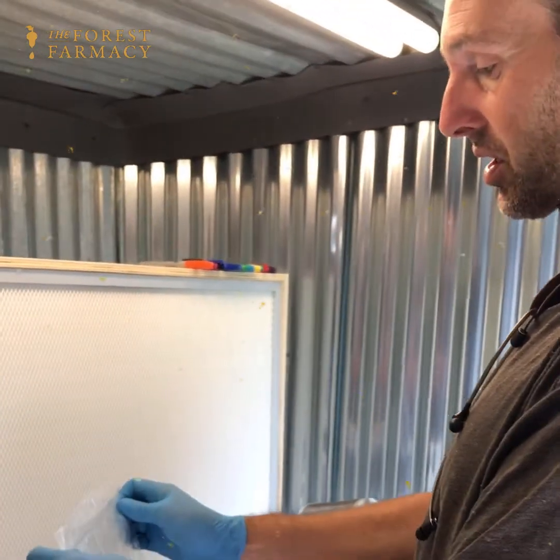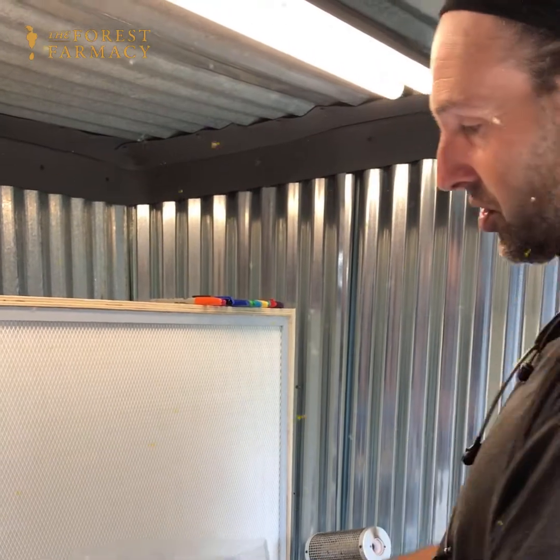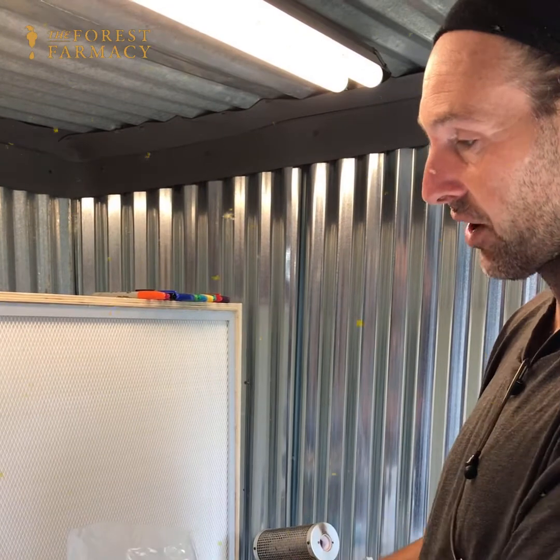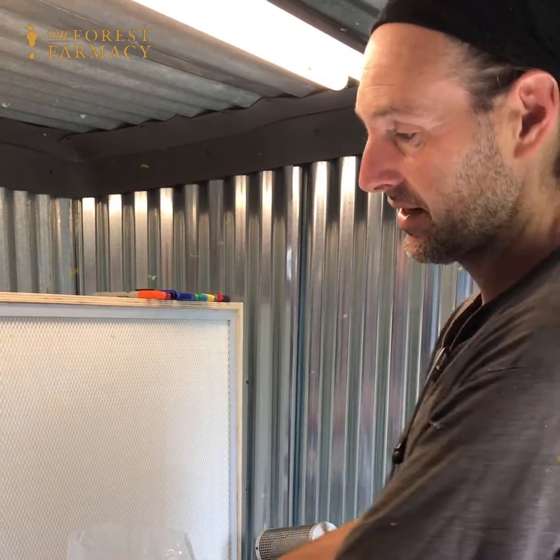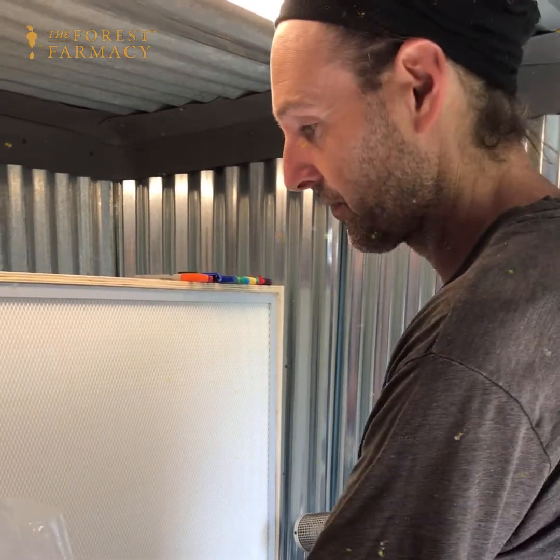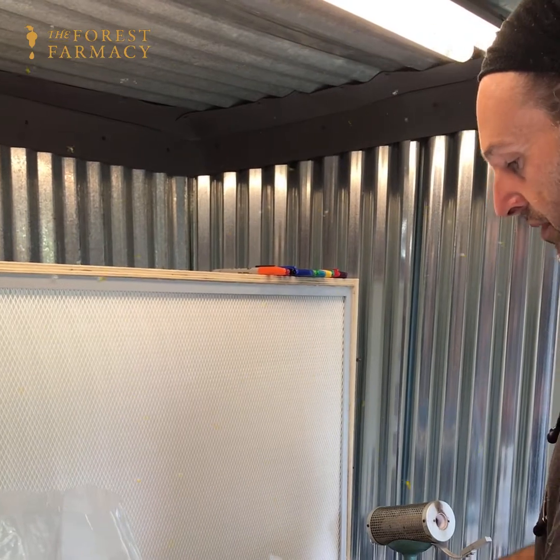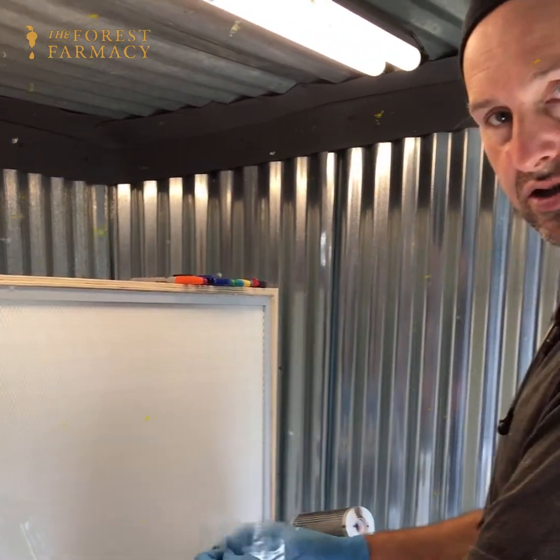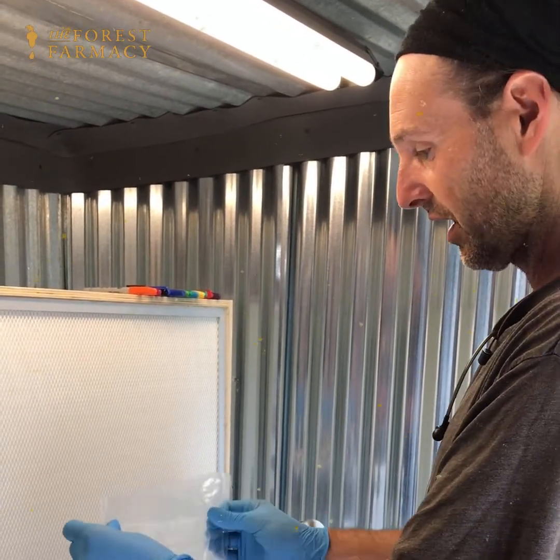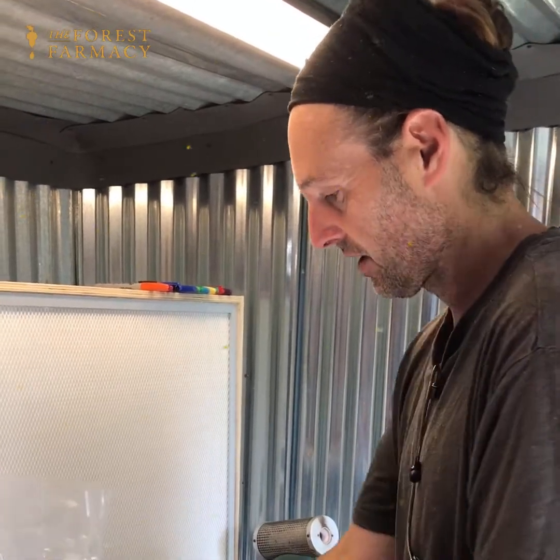I always try to work as close to the flow of the hood as possible. The reason I pull the bags back is in case anything falls off the outside of the bag — it doesn't get lifted up the side of the bag and potentially fall into the other one. When I'm done I'll scoot it back up close to the hood. Always assume that everything is contaminating — always assume that if it's not inside a bag or inside a petri plate, it's contaminating.